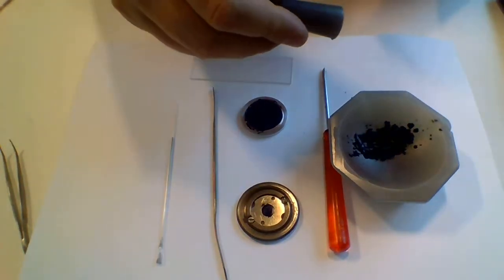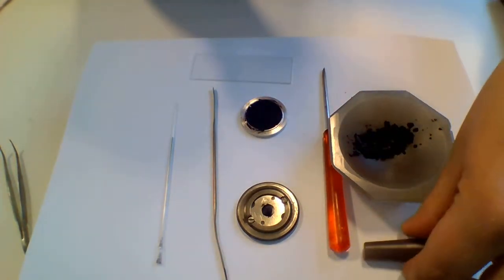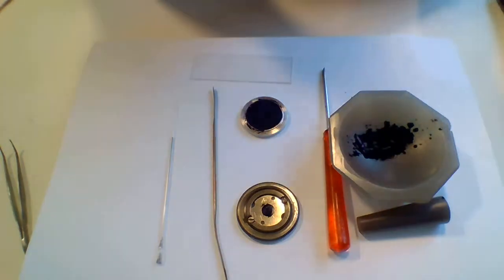This sample here is already ground, it's lanthanum hexaboride, and this is a sample that is quite often used as a standard for measuring the instrument resolution.